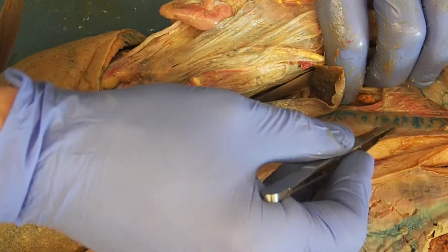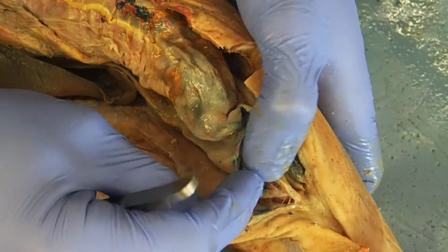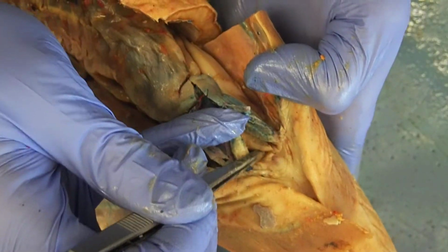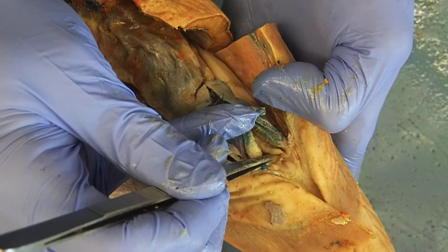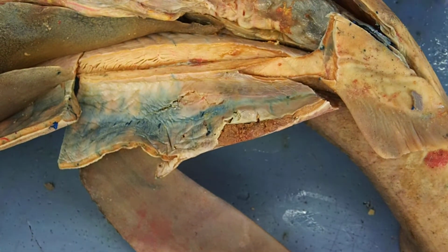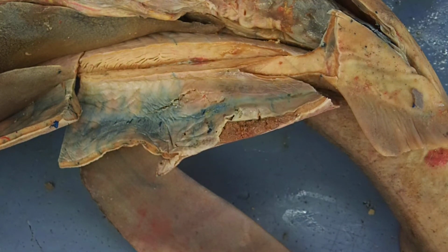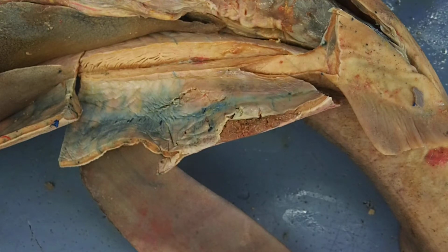Out through the archenephric ducts are running out of the kidneys and draining into that urinary papilla. Right here. This was a male, so that'd be urogenital papilla, because remember, with the males, it's an accessory urinary duct that's draining the lower portion, the posterior portion of the kidneys. The anterior portion of the kidneys are functioning as Leydig's gland, and it's draining seminal fluid into the archenephric ducts.